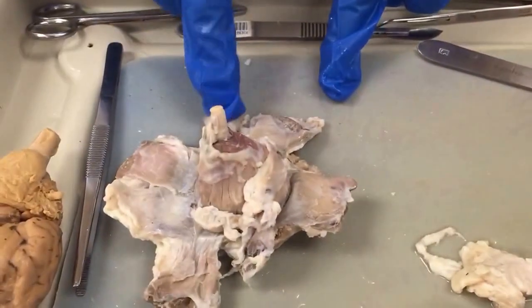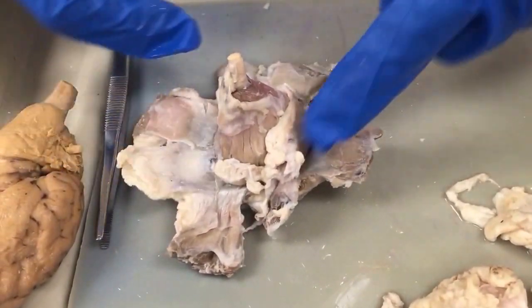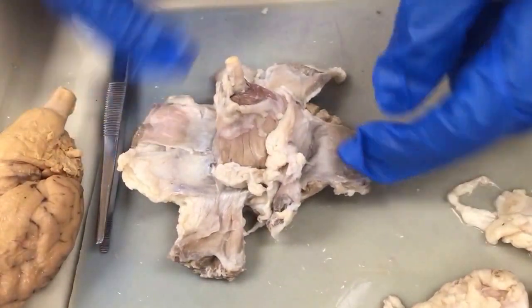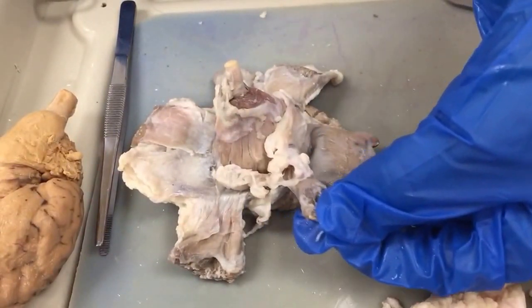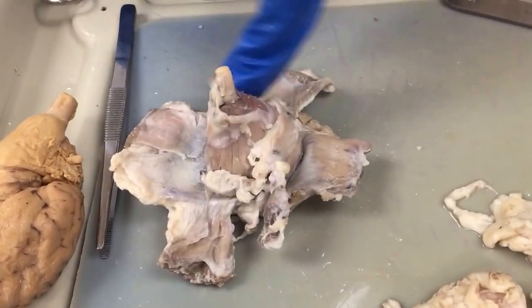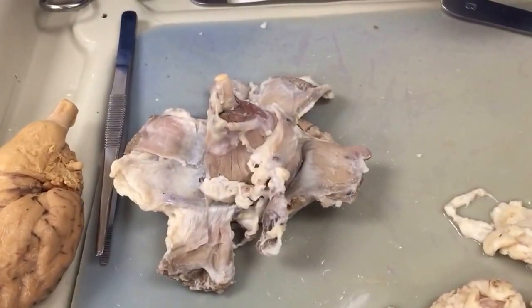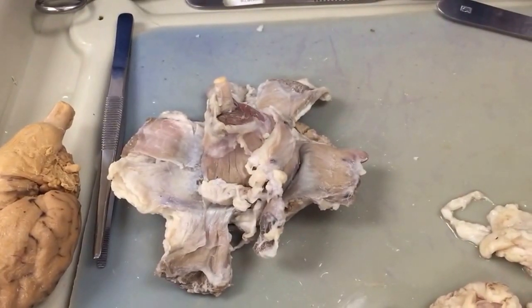So dorsal and ventral rectus, dorsal and ventral oblique, lateral and medial rectus, and then your skinny little levator palpebrae superioris over here in the corner, the lacrimal gland on the front, retractor bulbi muscle surrounding the eye, and the optic nerve there. Okay, all nice and clear?